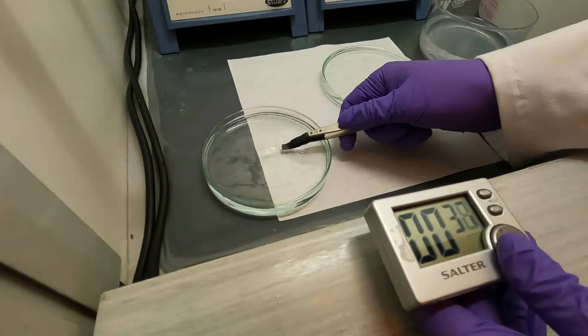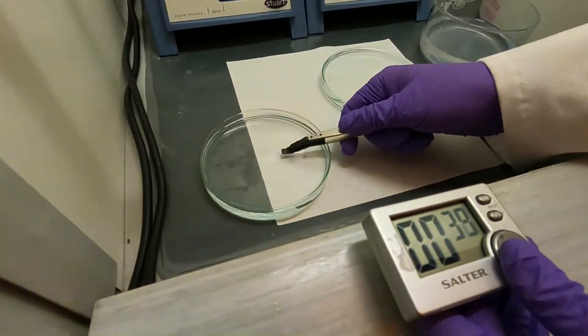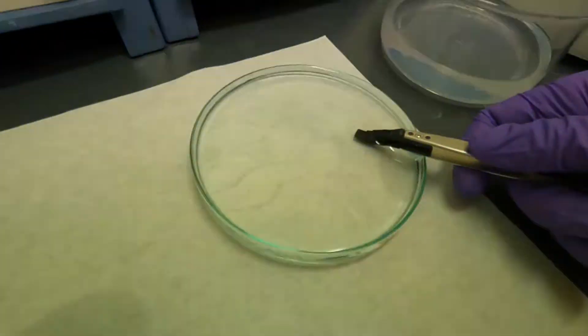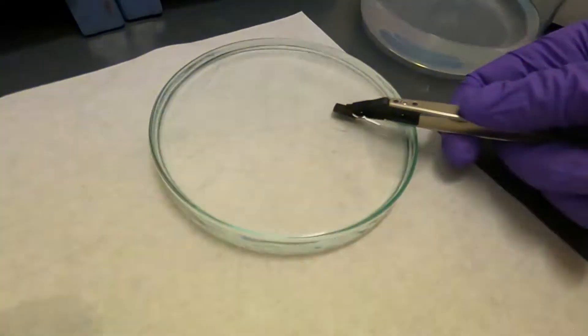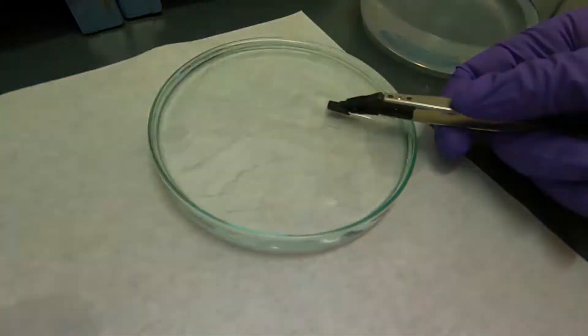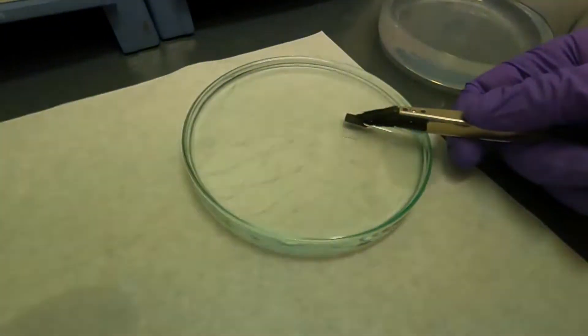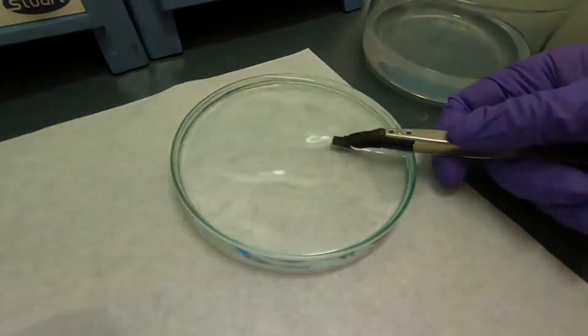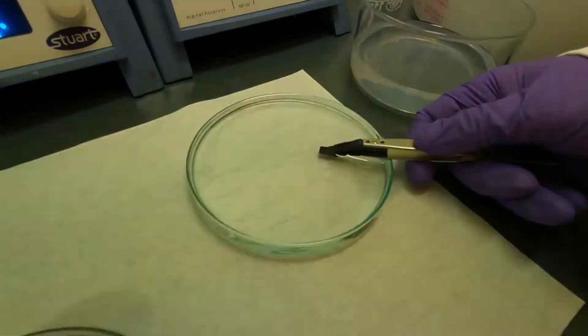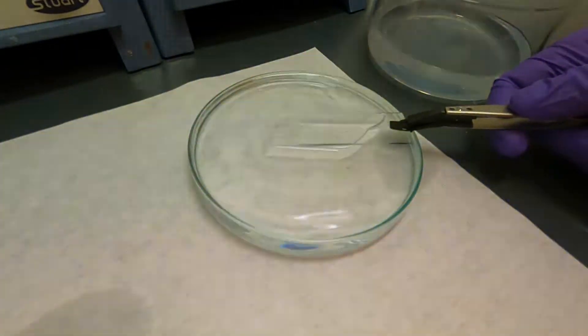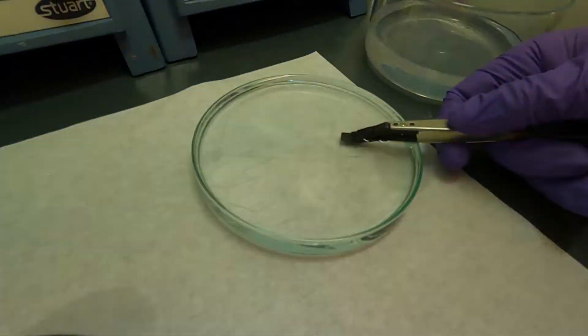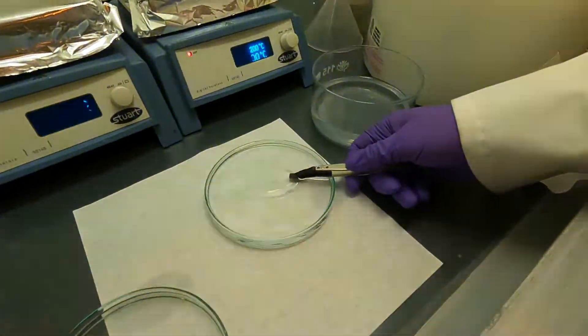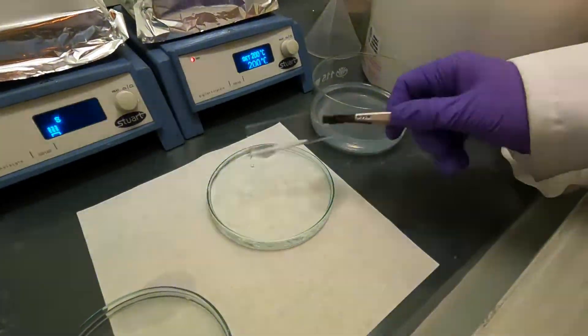We've got about 40 seconds now, so I'm going to take it out straight into the isopropanol. This time I can see that the sample is completely clear, so there is no residue of partially developed SU-8. I'm going to pick up the isopropanol bottle and get ready to rinse off the excess isopropanol and blow dry.